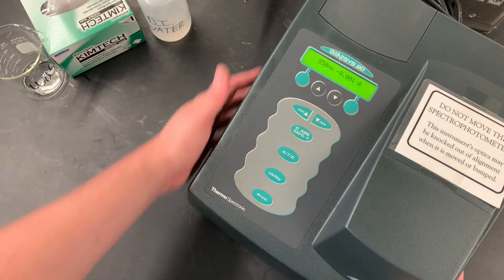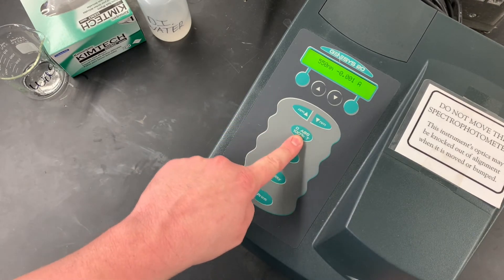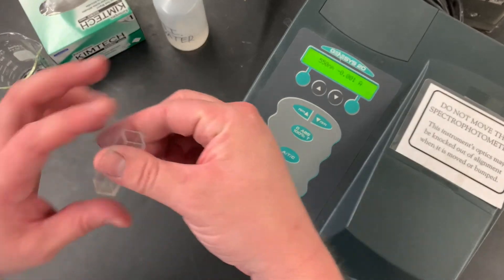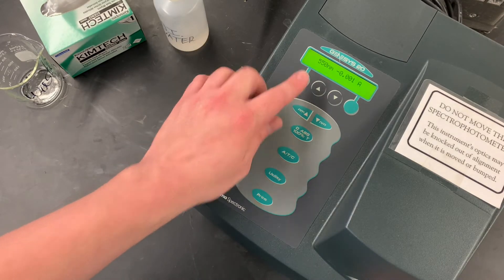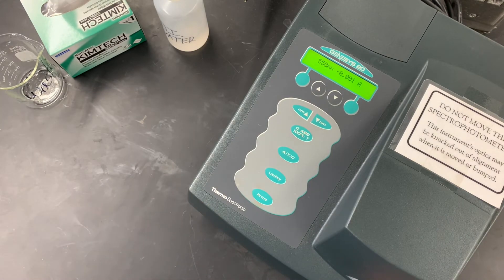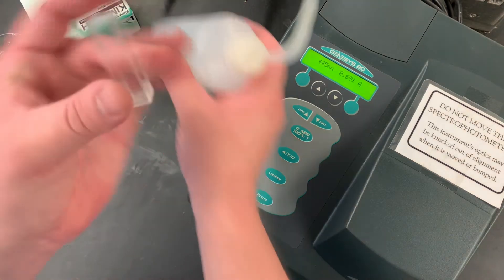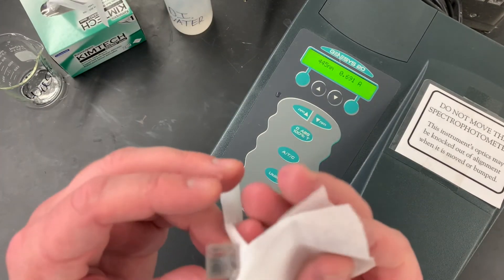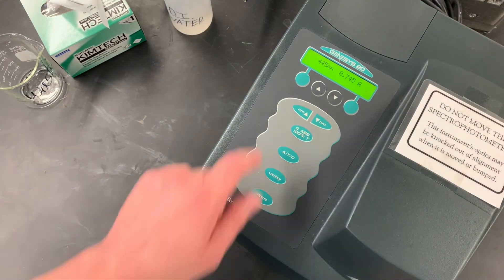Now, we've worked with spectrophotometers before — on switch in the back, let it heat up. We can adjust the absorbance wavelength right here, blank here, and then read our reading there. We will need some DI water for a blank, some kim wipes, and a waste container, as well as a nice, clean, dry cuvette, as well as all our solutions. Because we have to blank it when we change the wavelength, we have to do all of them at one wavelength and then do all of them at another wavelength. So we're going to start in this case at 445, grab our cuvette, top it off with some DI water, clean the sides from any fingerprints, and zero it — arrow forward and zero.